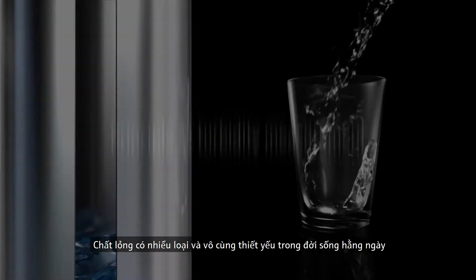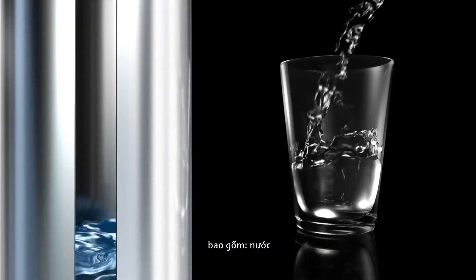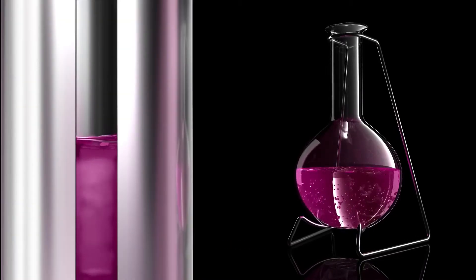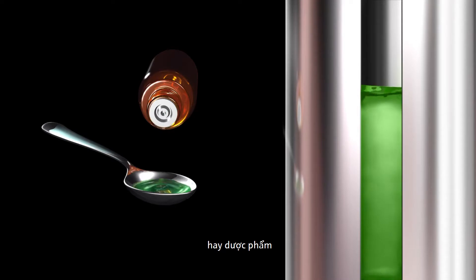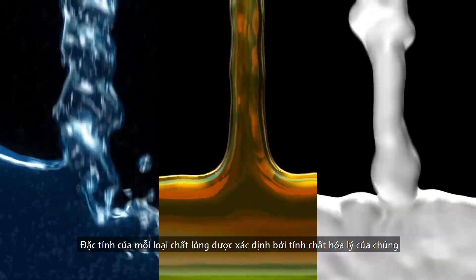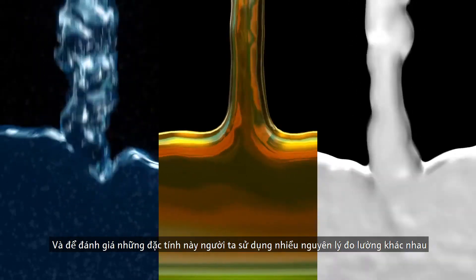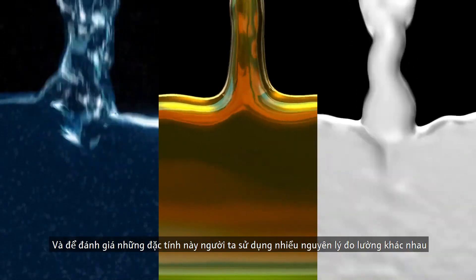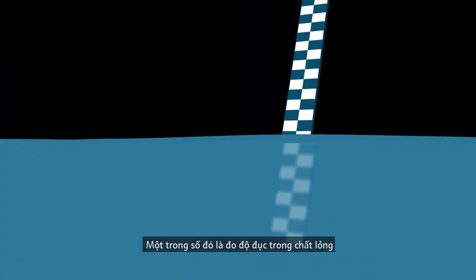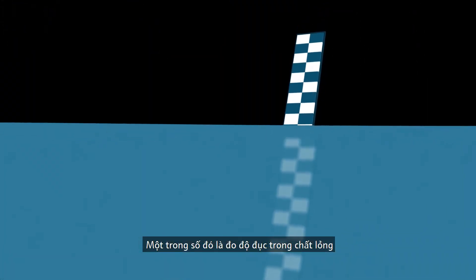Many liquids are essential in our daily life — they may include water, beverages, dairy products, chemicals, acids and bases, or pharmaceutical products. The quality of these liquids is determined by their chemical and physical properties. To assess these properties, various principles of measurement are used. One of these principles is the measurement of turbidity in liquids.